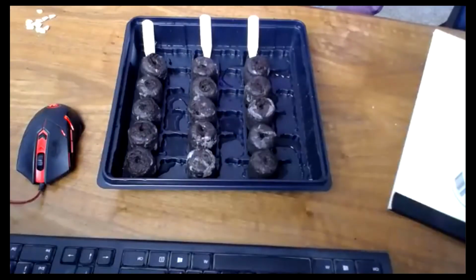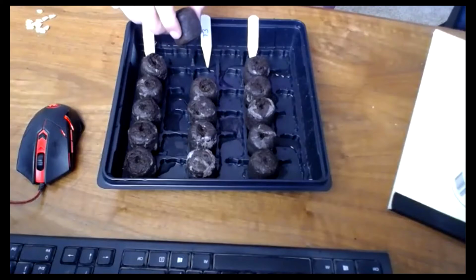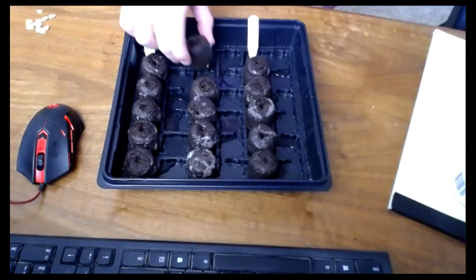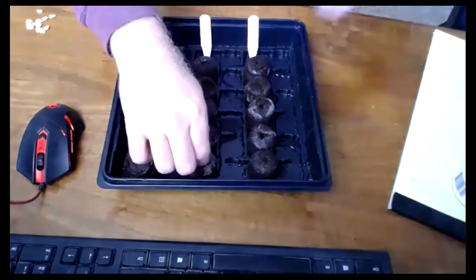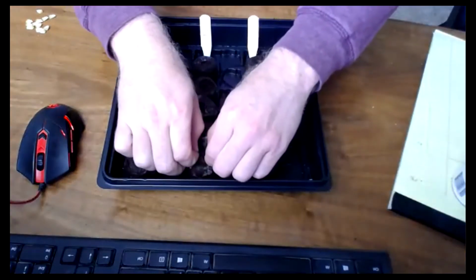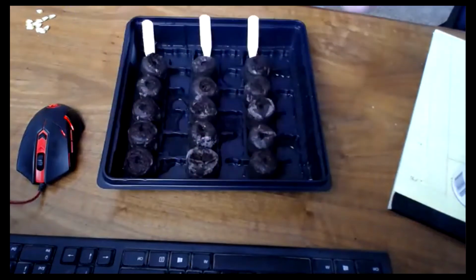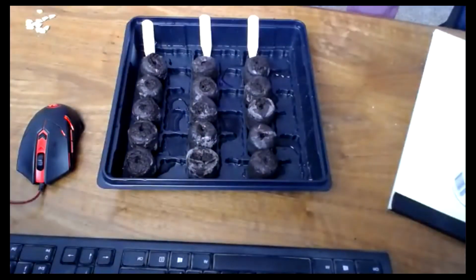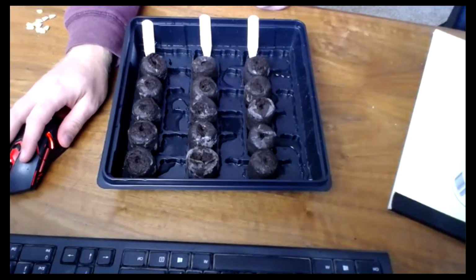At this point, my peat pots have fully expanded. They went from those wafers to these cool little containers for corn seeds. You might have to rip some open for a nice successful planting, but it should be fine. Now, at this point, we're going to plant our seeds. So I'm going to plant treatment 2 as described. Let me pull up the screen to read that real quick.